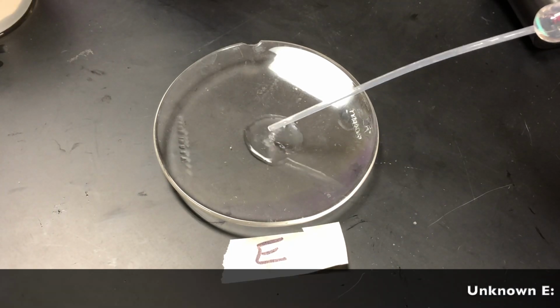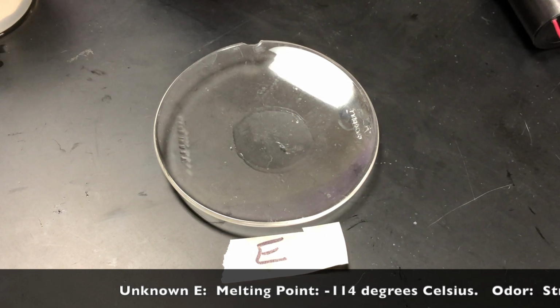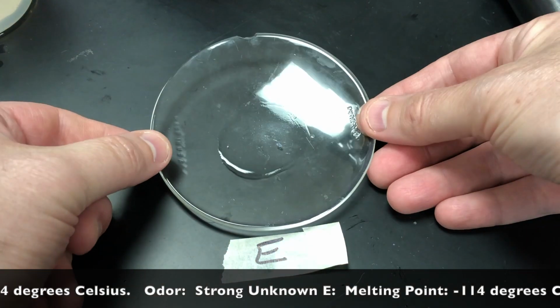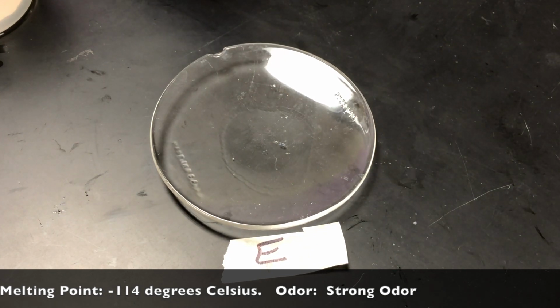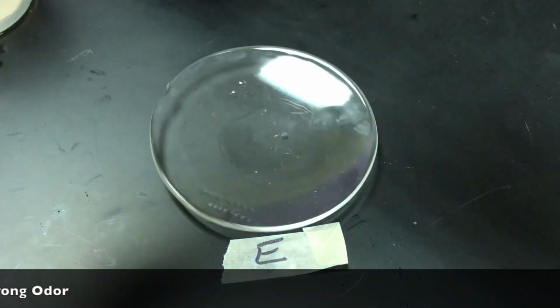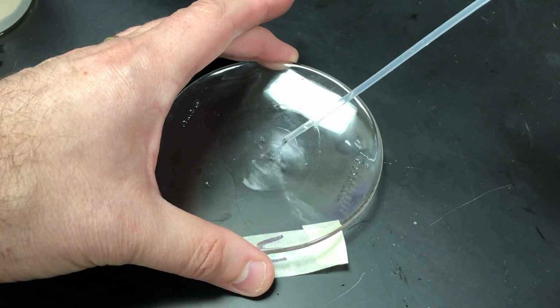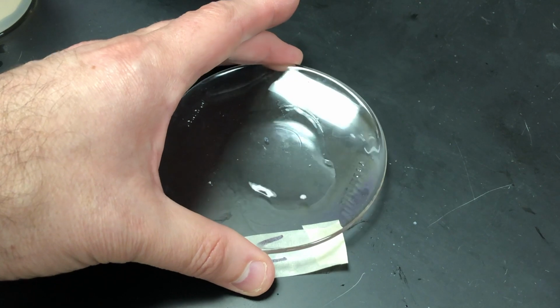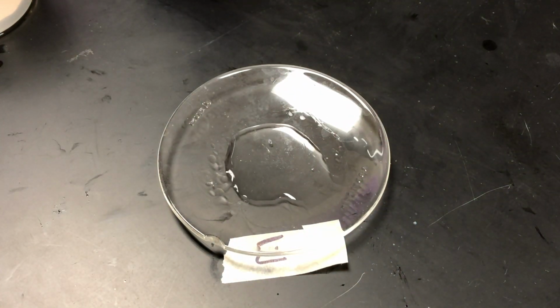Unknown E is a liquid. Now, in order to gauge the solubility of a liquid, what you have to do is look at the state of the liquid after you mix it with water. If it looks like there's a bubble or layers forming, then it doesn't dissolve. If it looks like one complete layer after you mix the water, then you can assume that it is dissolved. So take a look and see what happens after some water is added. As you can see, it looks like it mixes evenly.